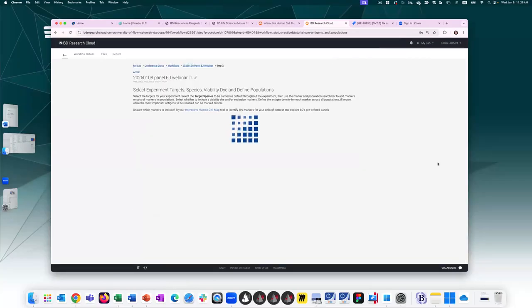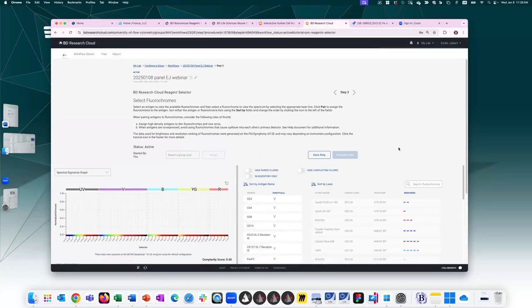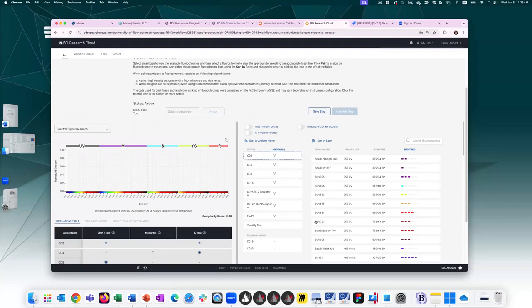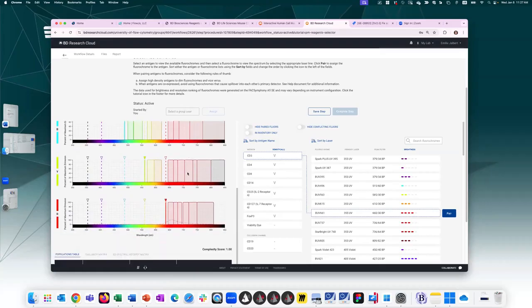So this is where you will assign your fluorochromes and keep in mind co-expression information, antigen density, and all that good stuff. So we're on step 3. The middle section shows the list of markers that you added in the previous step. So if I click here on CD3, the list of fluorochromes updates and shows me what CD3 is available in. I can click on the different fluorochromes to view their profile. So here, because I selected a spectral instrument, the default view is a spectral signature graph, but you can also change the view to the combined, where you can click laser line by laser line to see the specific detectors. You can switch it to stacked view to see all laser lines at once.